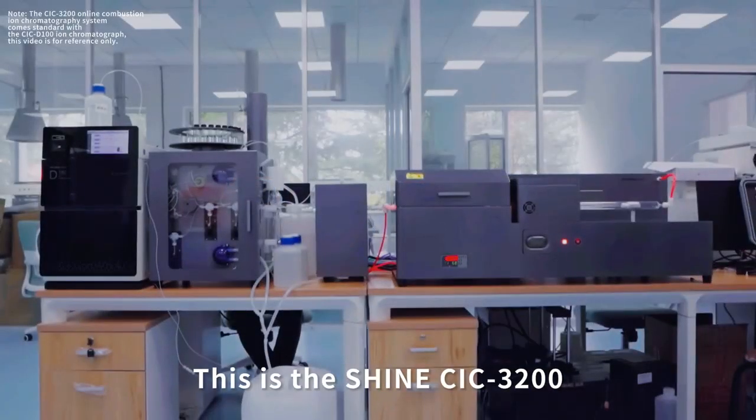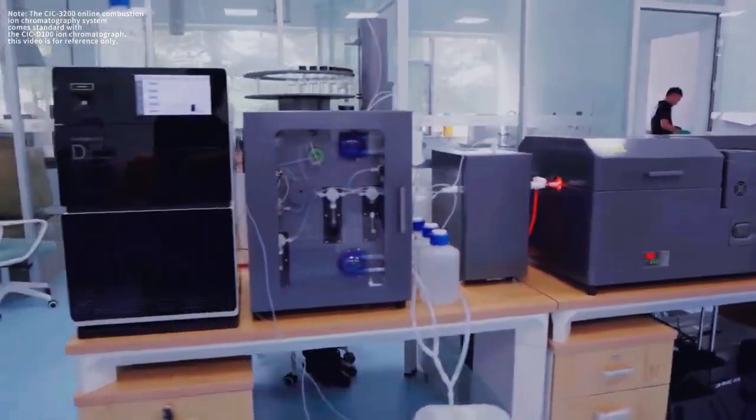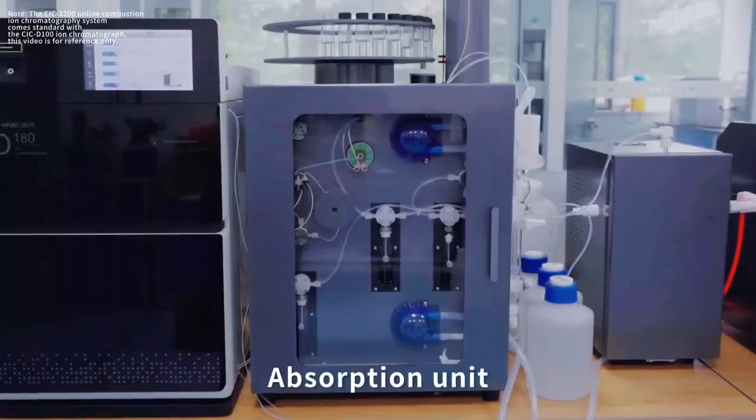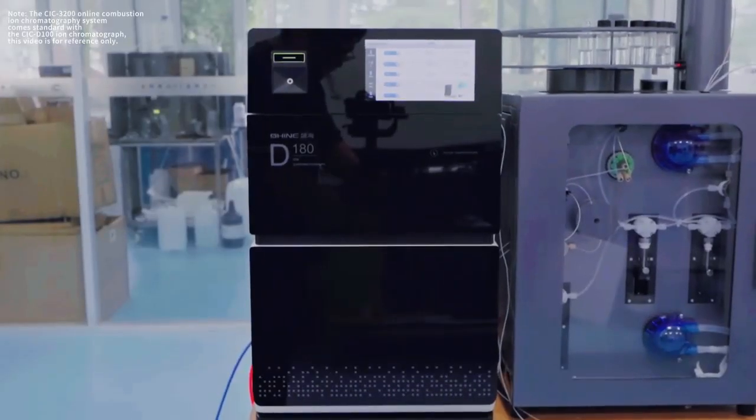This is the SH-CIC3200 online combustion ion chromatography system. The system consists of 4 modules: auto sampler, combustion unit, absorption unit, and ion chromatography system.